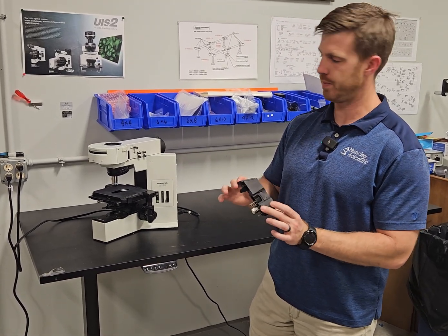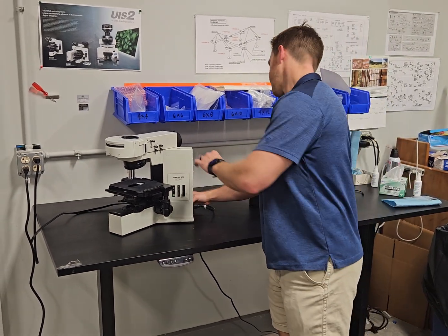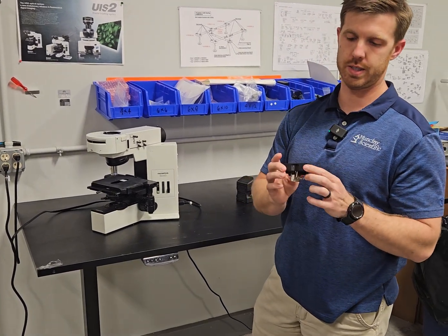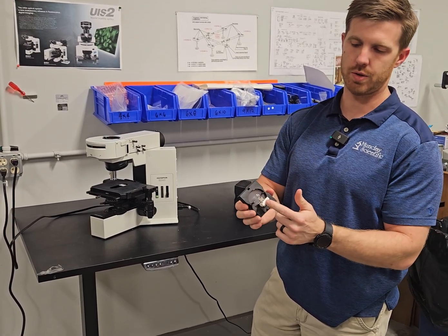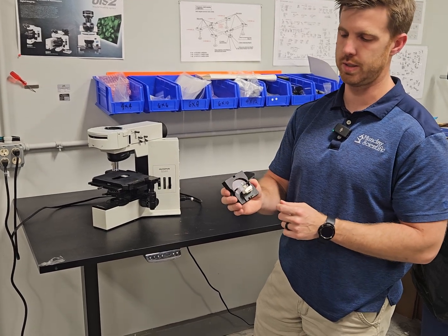Notice the shape of this one. This BX40 right here has the lamp house on it — that's the original. It's the U-LS30. It's a square. This one's kind of busted, but you get the point. It's just this basic square. The bulb goes right here in the socket and sits in this lamp house.